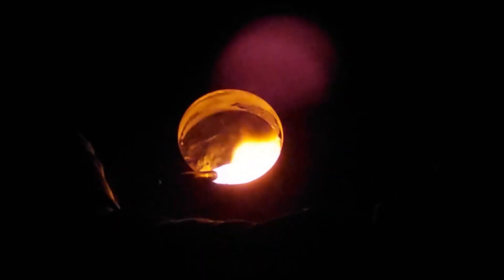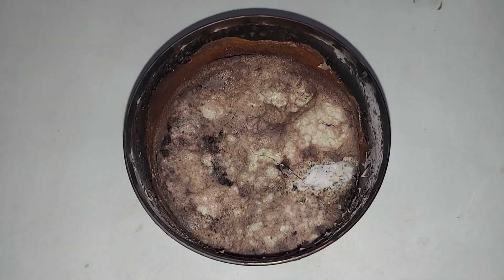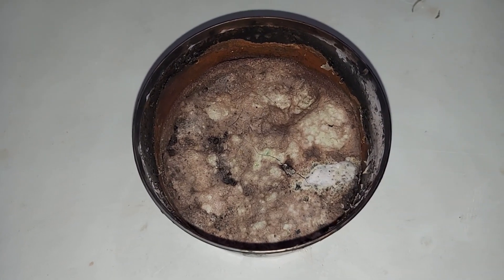The next step is to burn our potassium nitrate and charcoal mixture with the blowtorch. It's certainly not very pretty, but in there is our potassium carbonate. We now need to dissolve this in some distilled water.